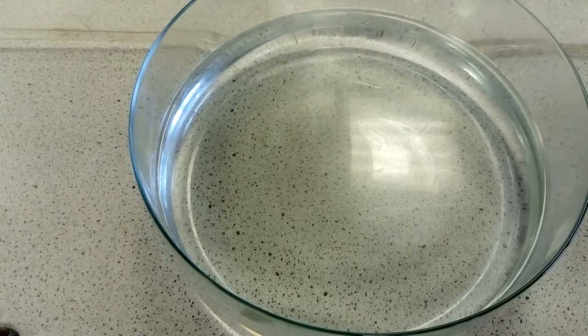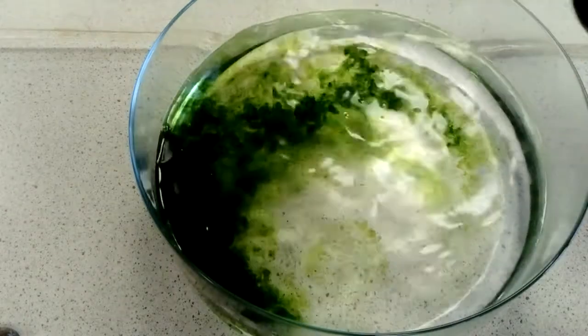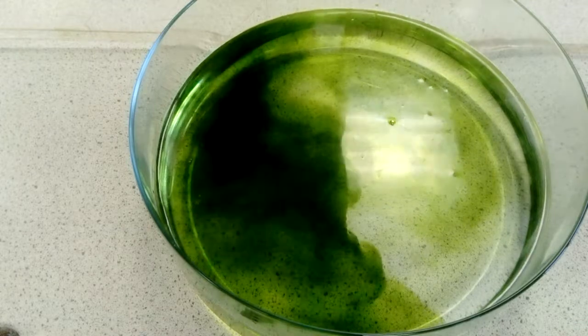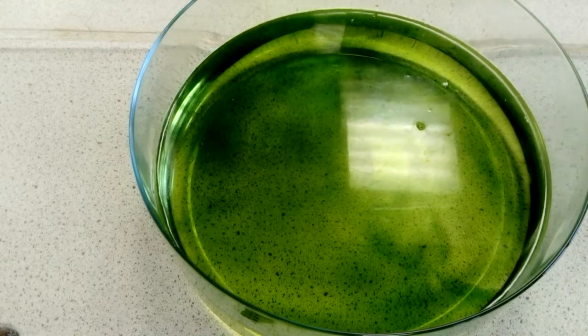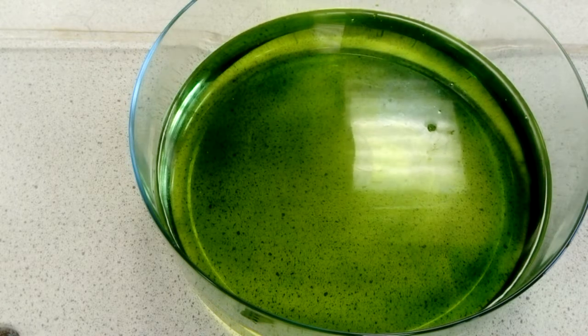So we will be looking at the reactivity of group 1 metals. To start off with, they're all called alkali metals because when they react with water, they should all form alkalis. Just to prove that, we've put in some universal indicator. If we get any alkalis present, it should turn a purple colour or a blue colour.